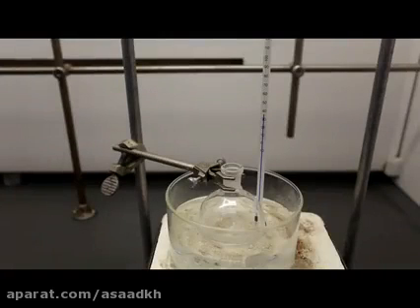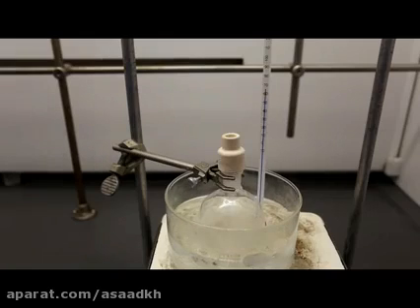After the addition is complete, remove the addition funnel, fix a thermometer, and replace the ice bath with warm water. Now turn on the hot plate and heat the water up to about 70 degrees Celsius. During this period, I placed the septum on top of the round bottom flask to prevent some of the water vapors from entering the flask and reacting with the acetic anhydride. Once the temperature of the water bath reaches about 70 degrees Celsius, you can turn off the hot plate and let the round bottom flask sit in the hot bath for about 5 minutes.